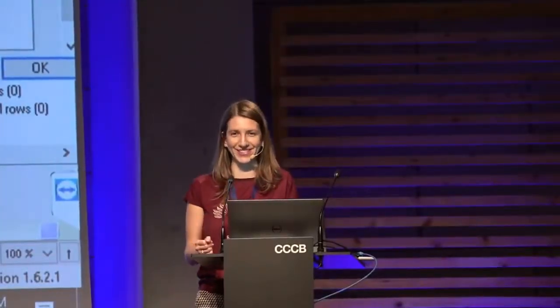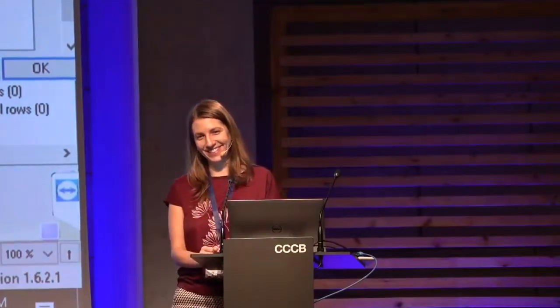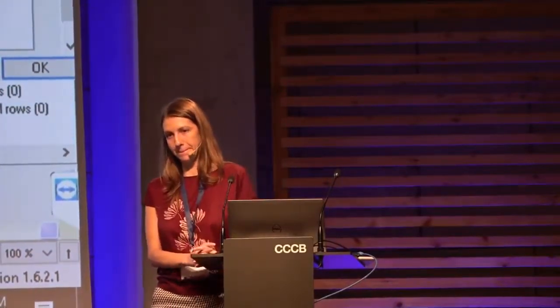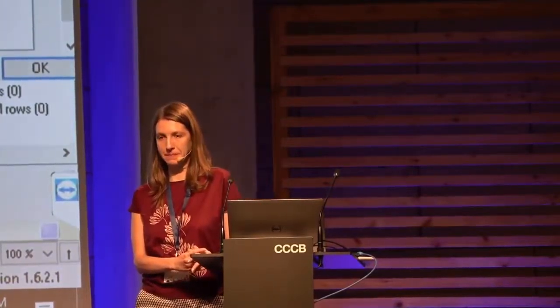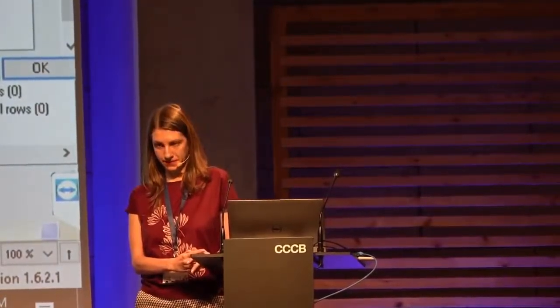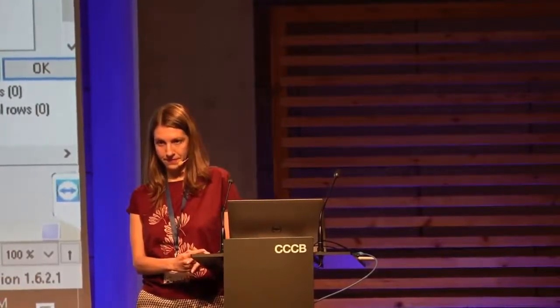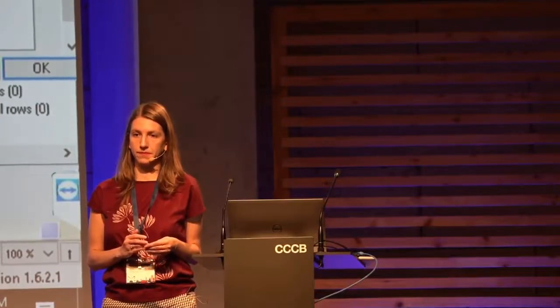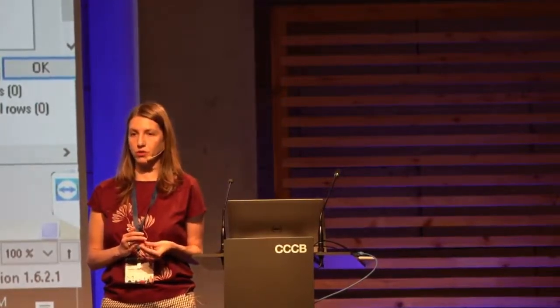I see a lot of questions all of a sudden. Yeah, we haven't done imputation yet, but I have actually done imputation in Perseus using this option. And usually what I notice is that the intensity values that are replacing the NaNs are very low. I'm just thinking, it seems like the imputation method, as you said, always assumes that it could have been detected, or it can't be detected because the intensity level is too low. But I think in reality, you usually have a mix of missing at random, meaning that in DDA, something wasn't chosen, but it could be detected. But exactly, in DDA, you usually go for the top n peaks, right? So I think it's a valid assumption, but you're right.